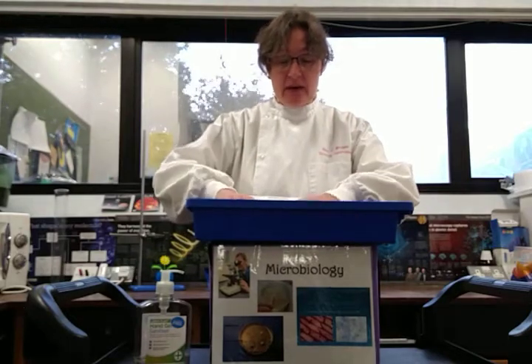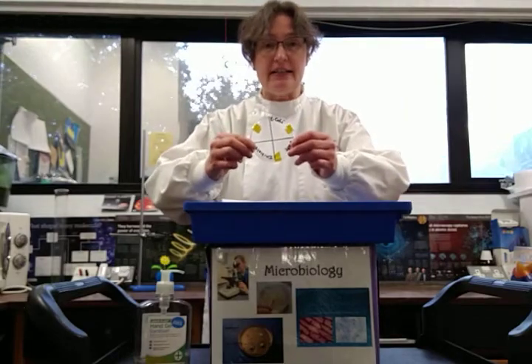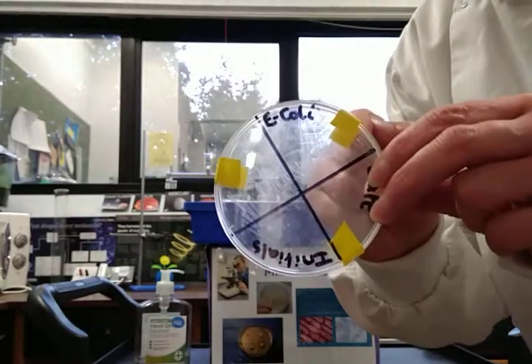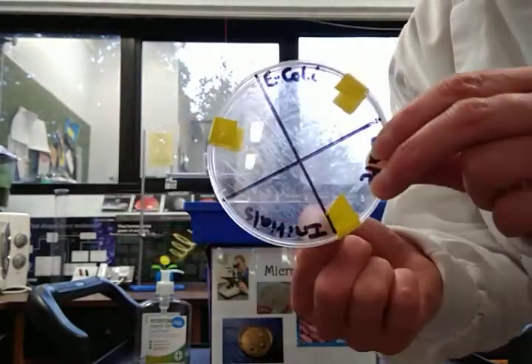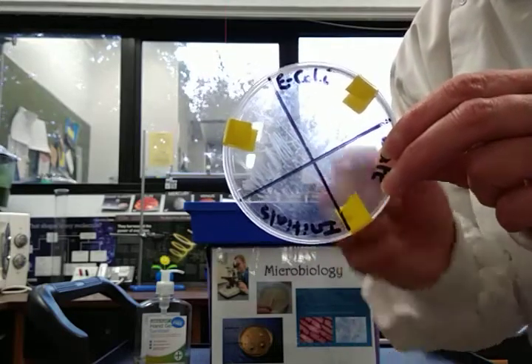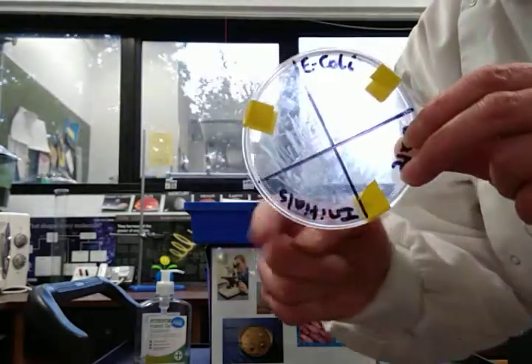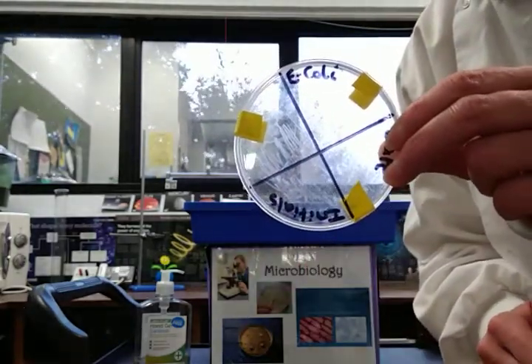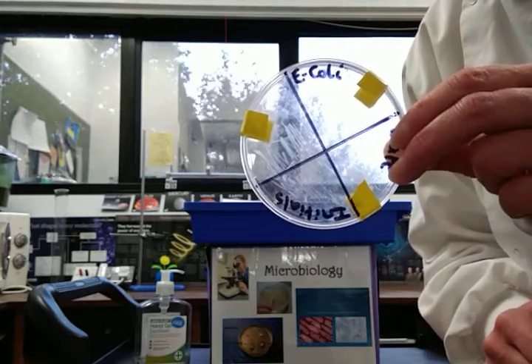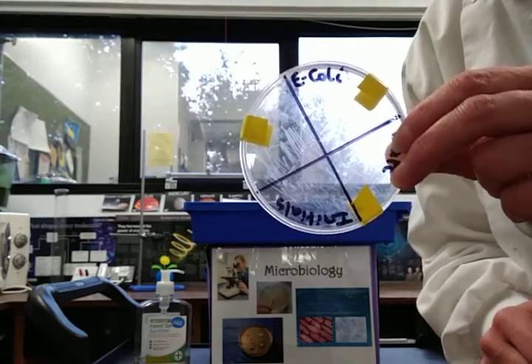I seal up the petri dish in a very special way. We only partially seal it. I'll bring this closer so you can see. We just put 3 small pieces of tape around the dish like that to keep the lid onto the rest of it. We have to be very careful not to seal it all the way around. If we were to do that, we'd cut off the oxygen supply to the petri dish and we would run the risk of growing anaerobic bacteria, and they can be harmful to human health.